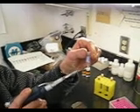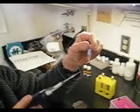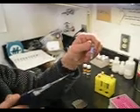We first weighed out the 10 milligrams, added one milliliter of solvent, and you can see right here at the tip that not all of the matrix has dissolved. That's okay. Sometimes you centrifuge out the remaining particles, or you can use it directly, just being aware that you might have some pure matrix particles in your sample.